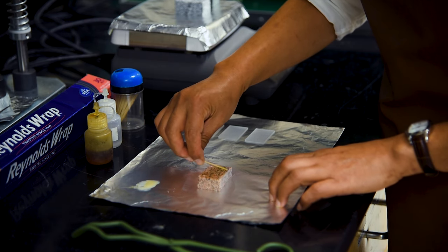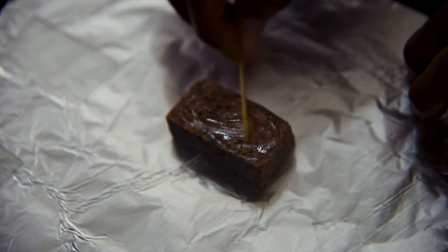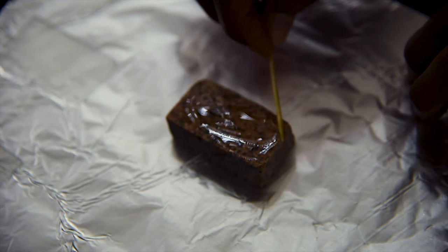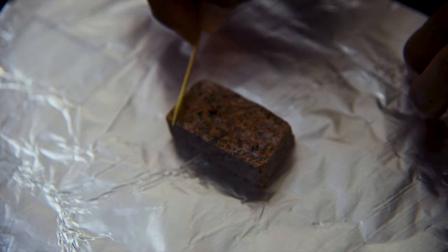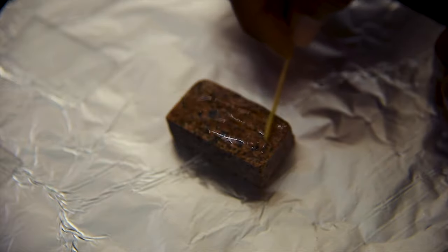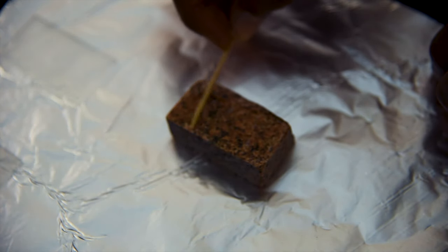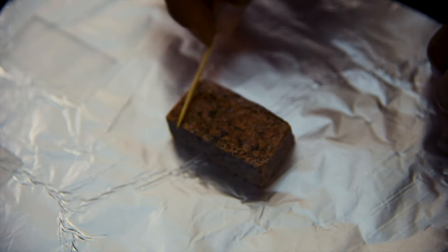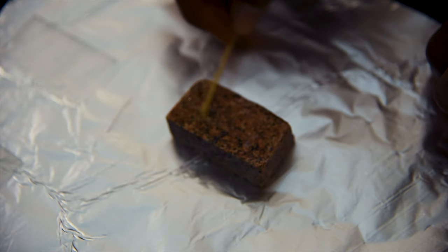Many rocks are porous, including some that you might not expect, so you must let the epoxy soak and penetrate fully into your sample, or the thin section may not survive the final grinding stages. Spread the epoxy, wait for it to soak in, apply some more epoxy, and if necessary repeat until no more epoxy soaks into the chip.